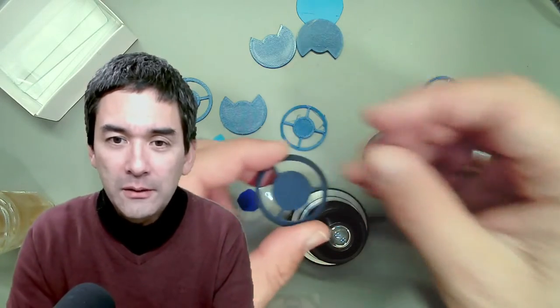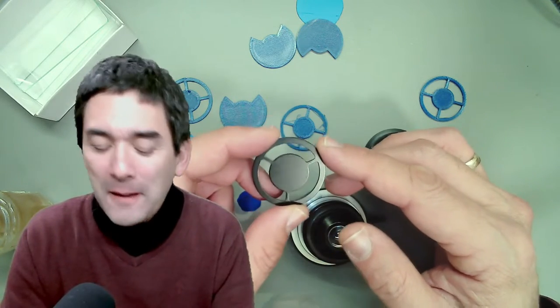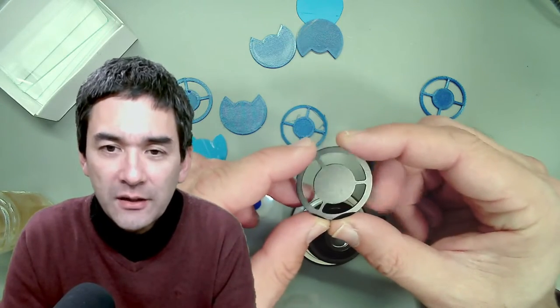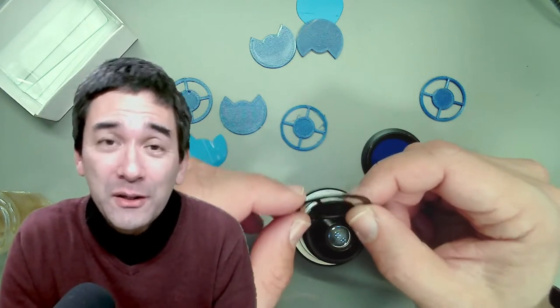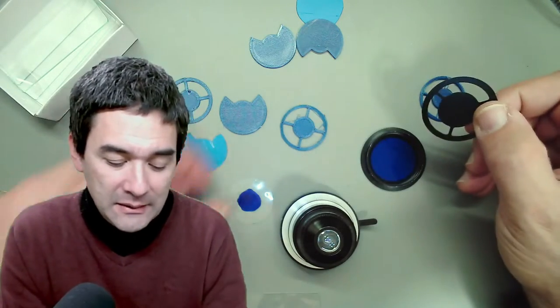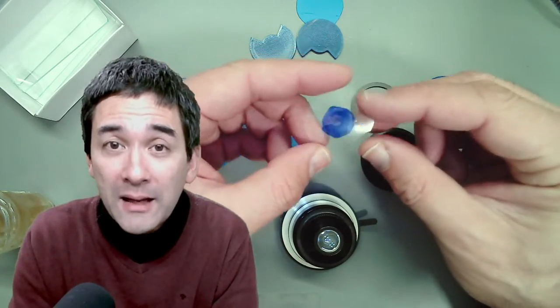Today I would like to show you how to do a simple upgrade using a dark field patch stop. It is possible with very simple additions like these so-called dark field or patch stops to improve or change the image under the microscope in such a way that it looks a little bit three-dimensional — it casts shadows, the image does not quite look as flat anymore.